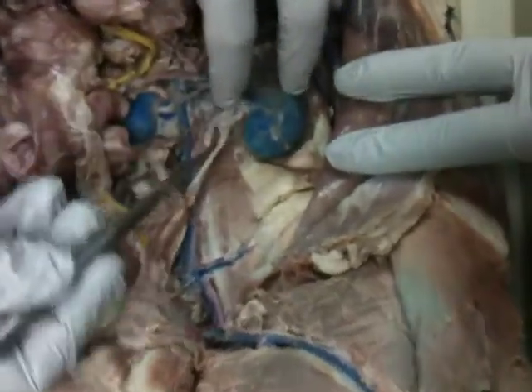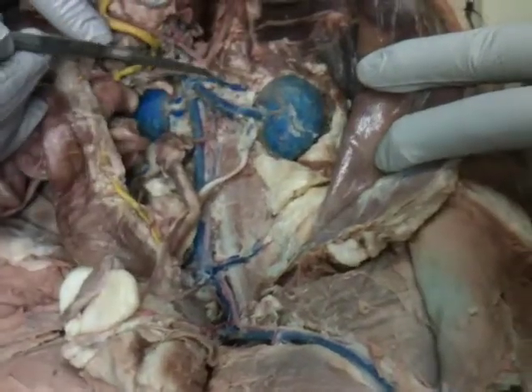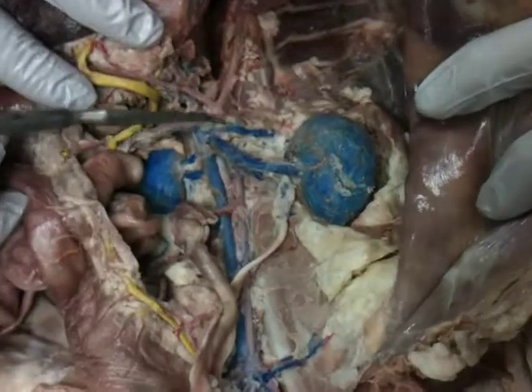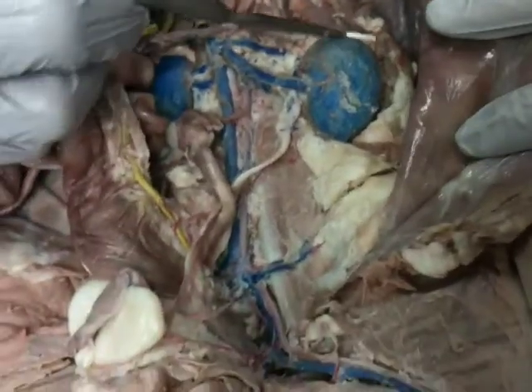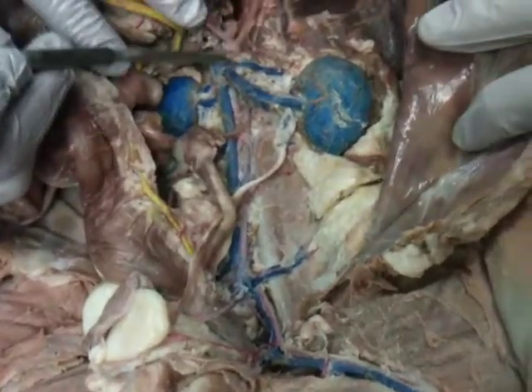Oh, I forgot to mention this one. Here we have a renal artery. Good. Oh, the adrenal gland is this little guy right there. That's the adrenal gland. And it is different on a cat. In a human, it is more on the superior part of our kidney. That's what I thought. There's the adrenal guy.